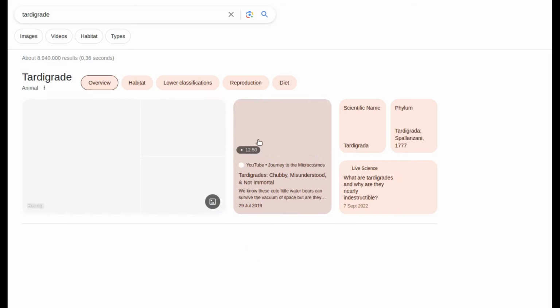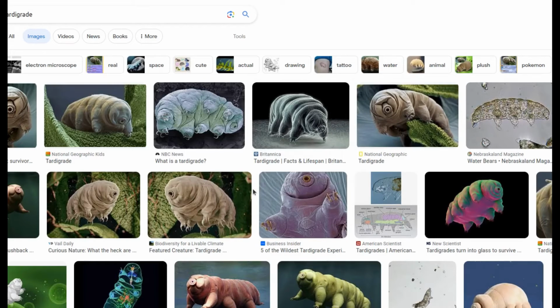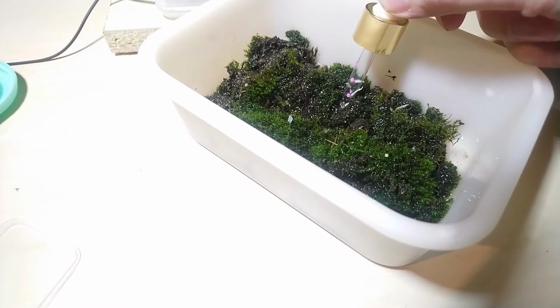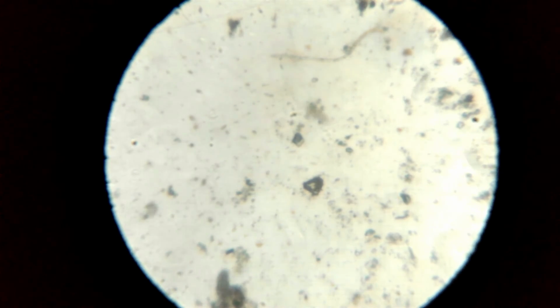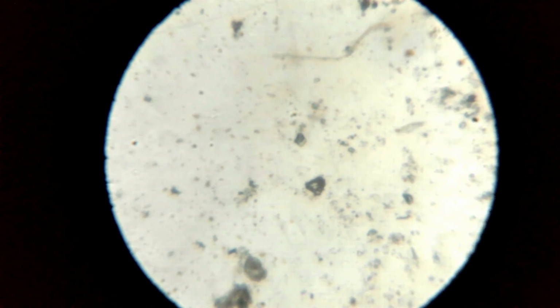One of the coolest things to see under the microscope are tardigrades. They look like tiny bears and they live in wet moss. Let's see whether we can find one. It has rained here a lot lately and I used the chance to grab some wet moss from my backyard. A lot is going on in my sample. Here are the typical algae and also Paramecia.